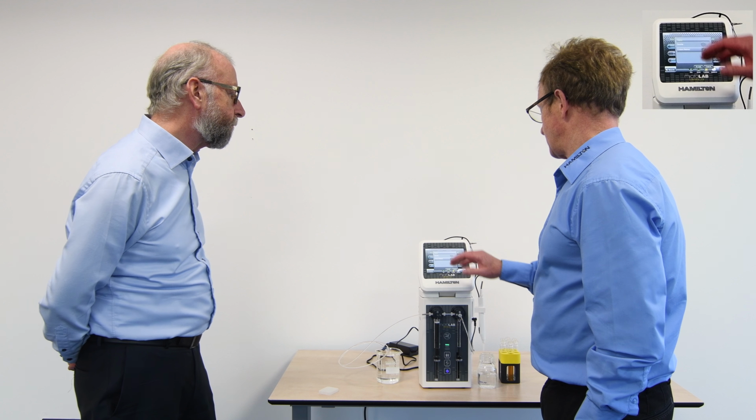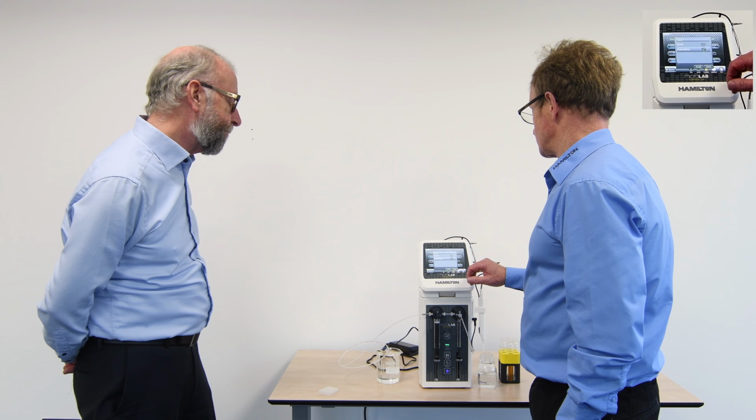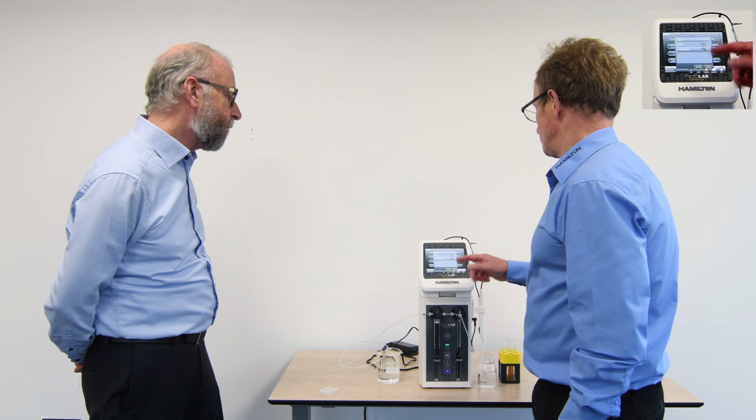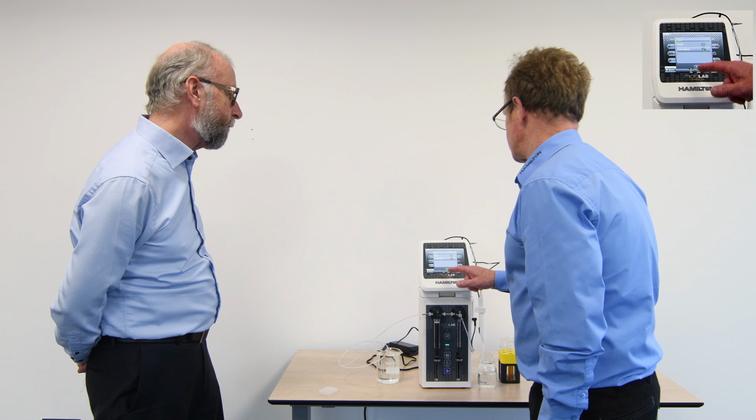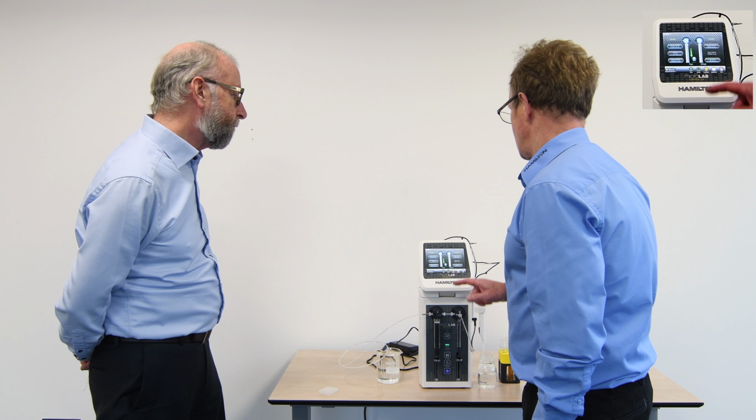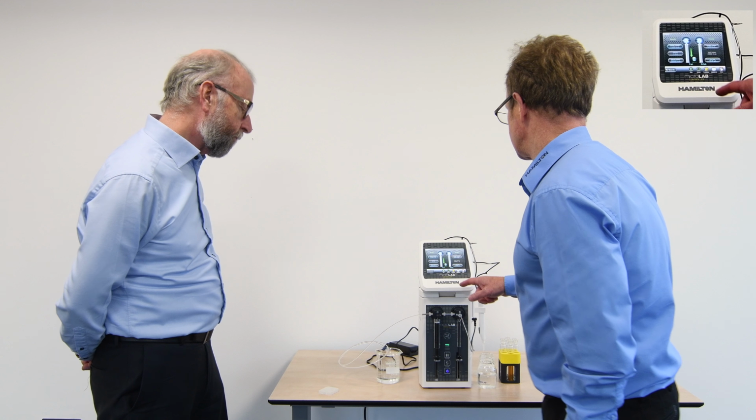So I'll save that, and then we'll have a look at actually how it goes. Yep. This is a custom program. Okay. So we'll look at your TriCAD sample here and enter that. Yep. And then we'll take it as that program. So I've already gone through a process of entering that here for a moment.